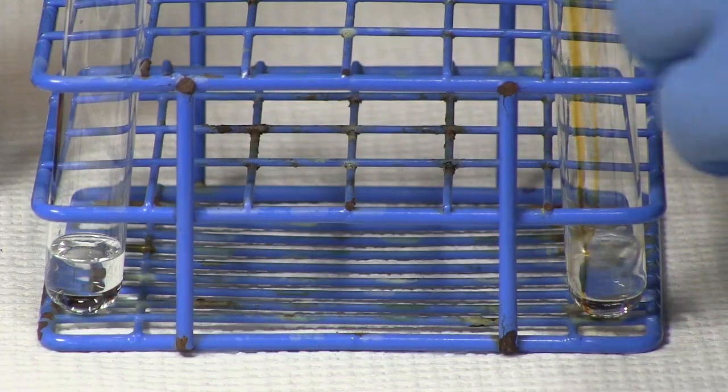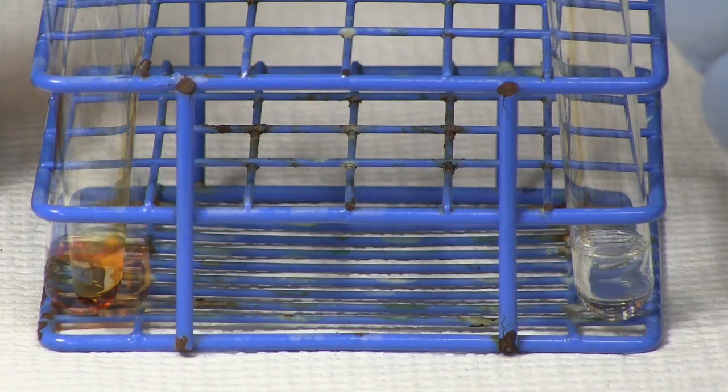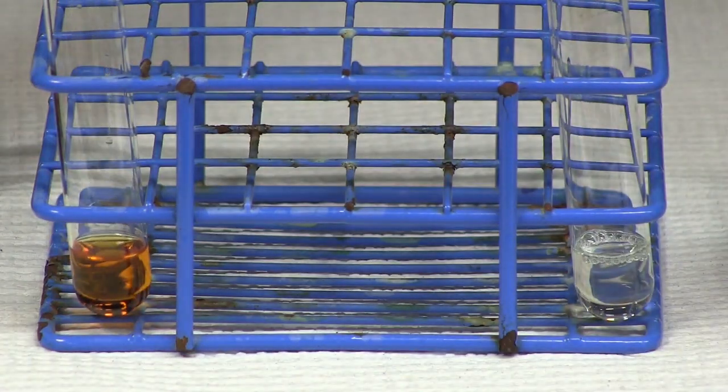Next, add a few drops of 1-molar bromine solution to each test tube and note whether the red-orange color persists or dissipates upon addition.